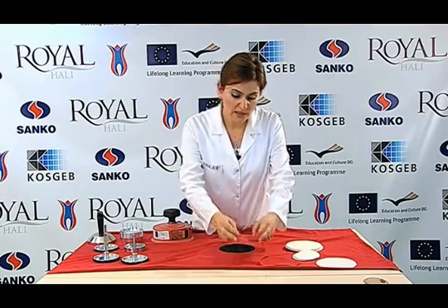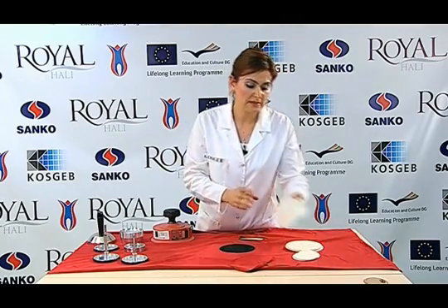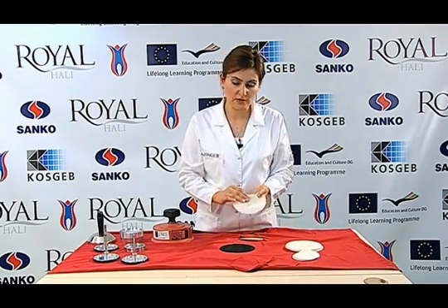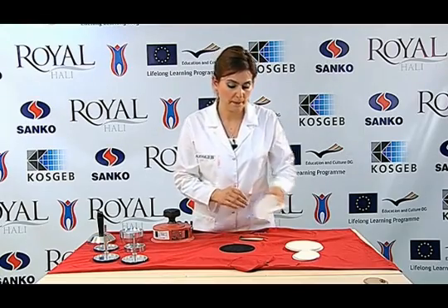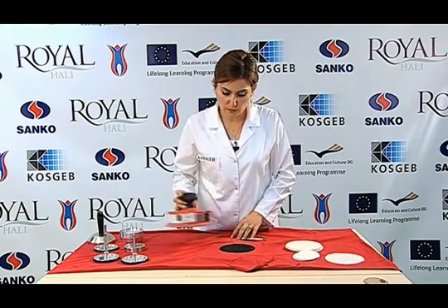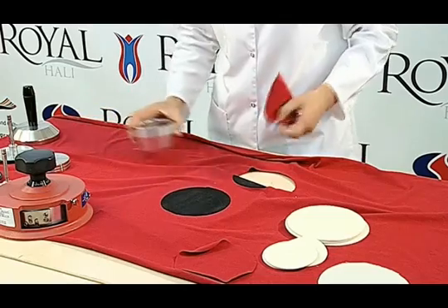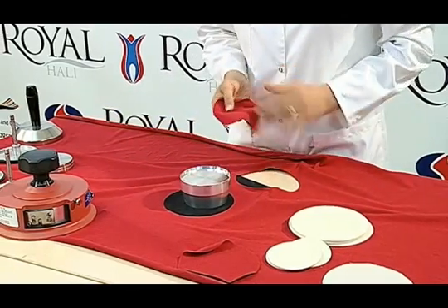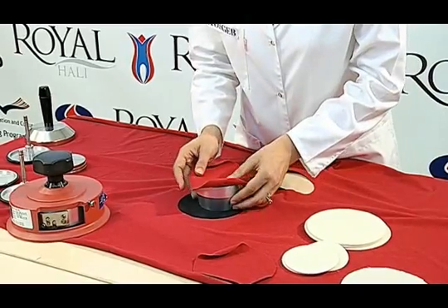We cut knitted and woven fabrics as abrasive fabrics and prepare three pairs of samples randomly exhibiting all characteristics of the specimen. We use standard felt as abrasive cloth for upholstery fabrics; the diameter of felt fabric is 140 mm. We place the sample cut in a way that the front side of the sample positioning apparatus looks downwards.